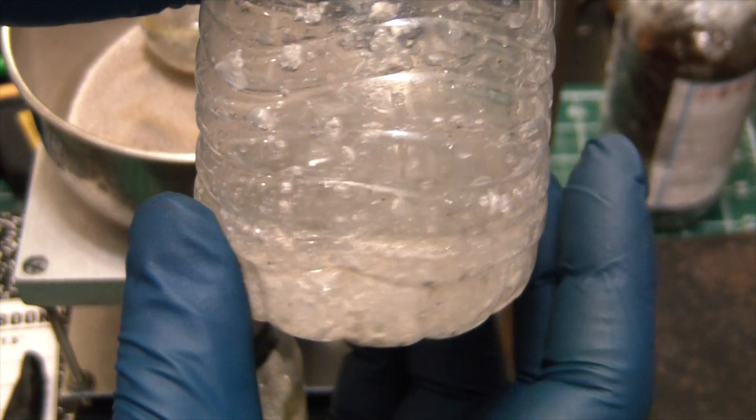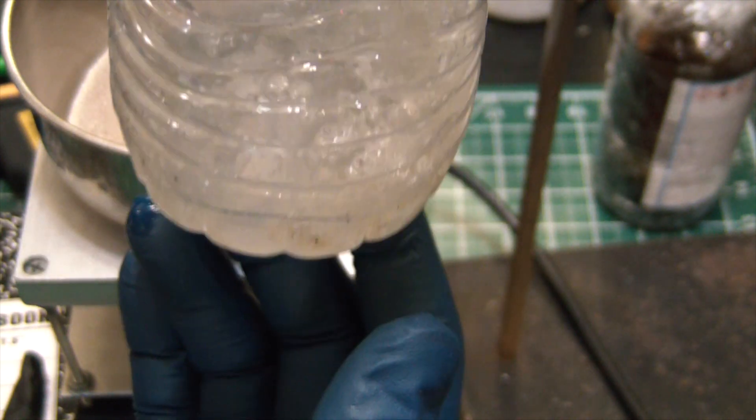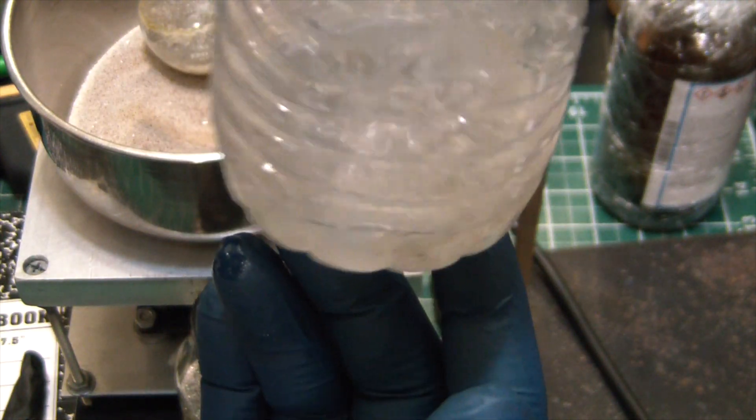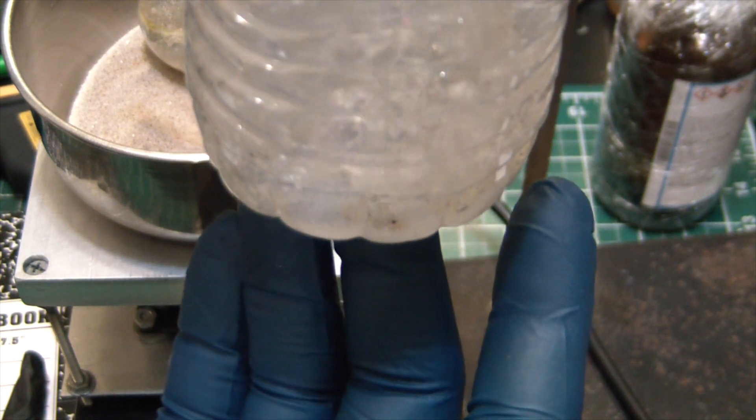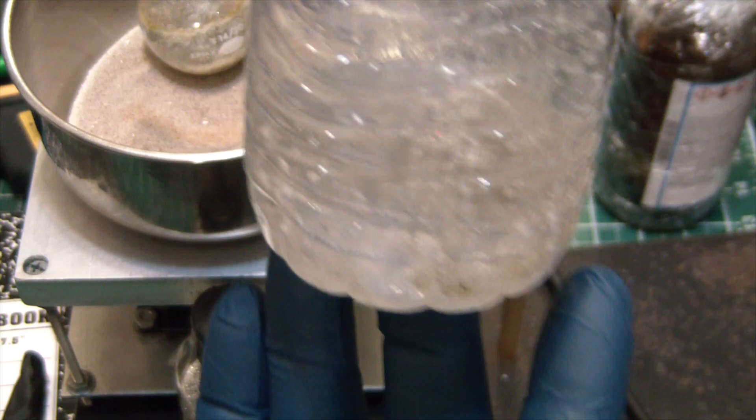So what we will do is give it another shot. I guess the magnesium is okay. I just have to intermix the hydroxide and magnesium and I think we will see a much better result next time. Awesome.